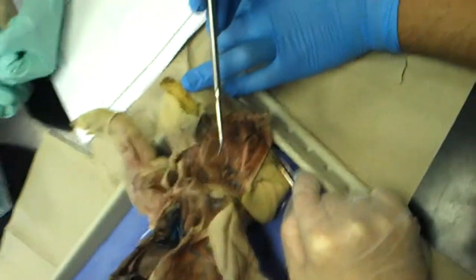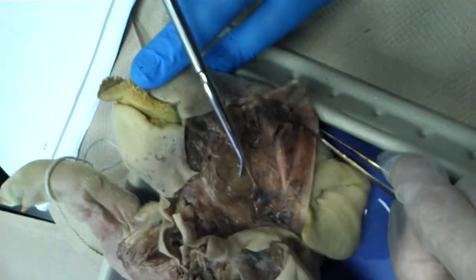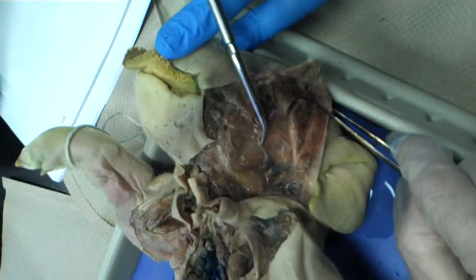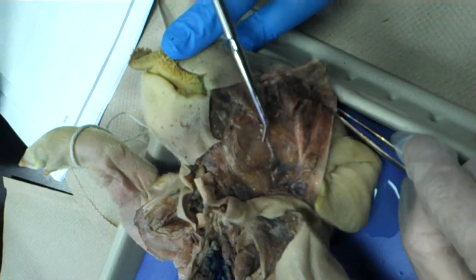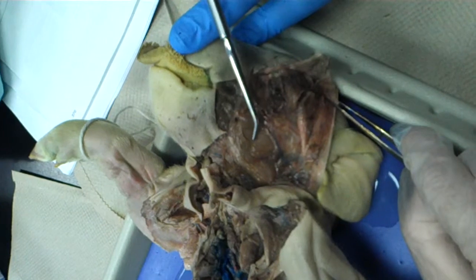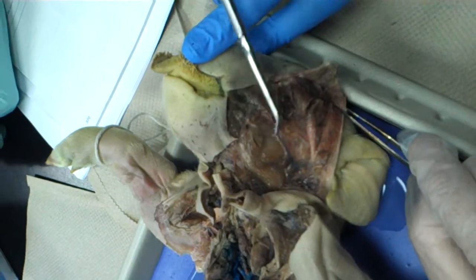Okay, this is what we found out so far. This right here, this little thing is a nerve — this is a facial nerve. Right underneath it, that's the masseter muscle.